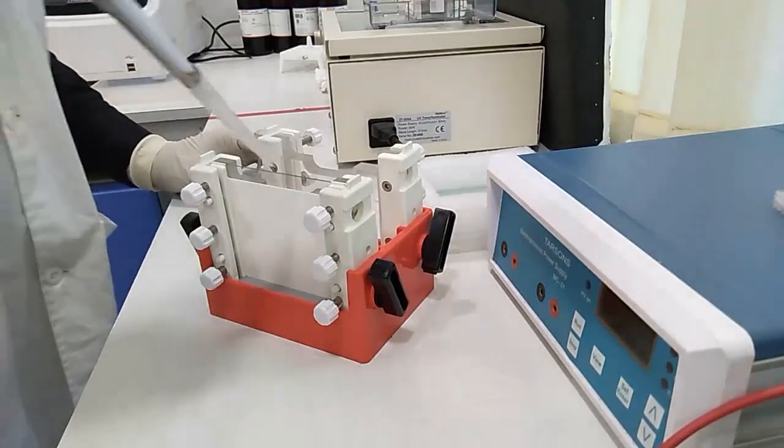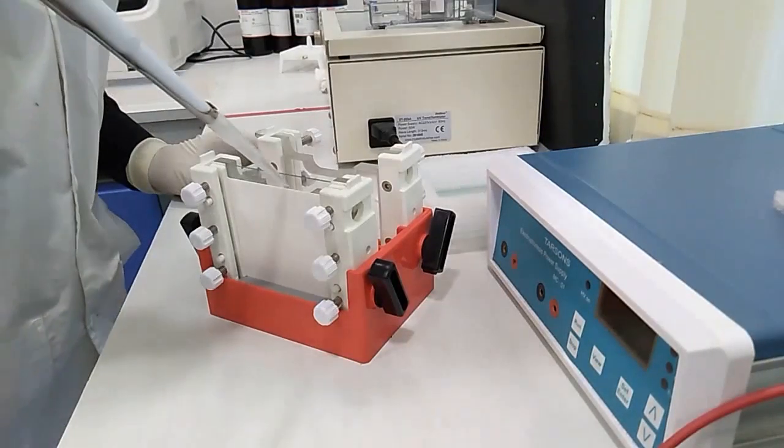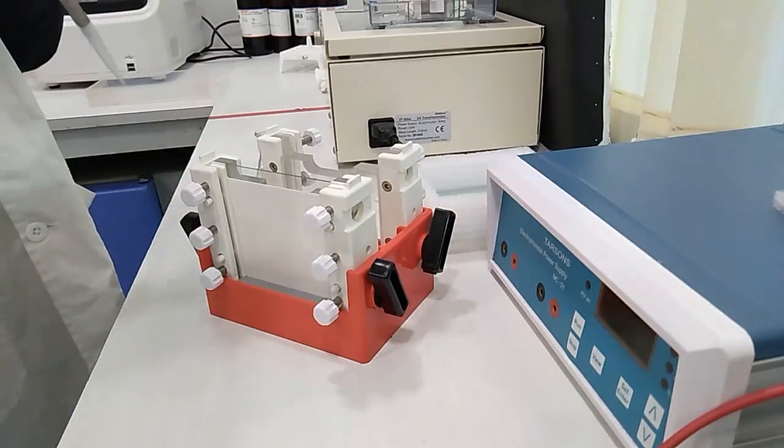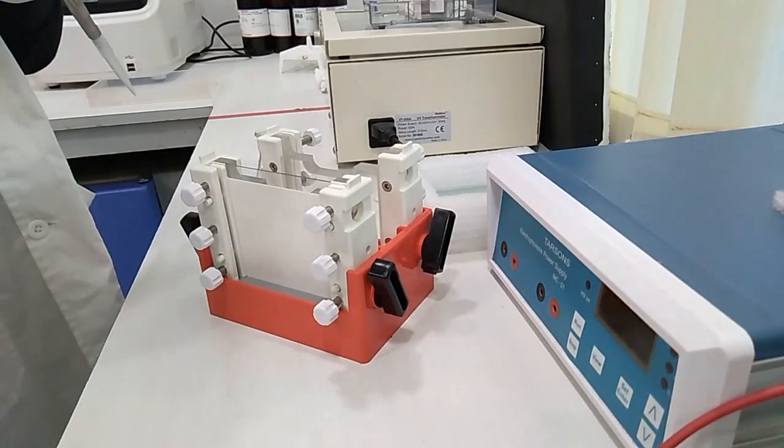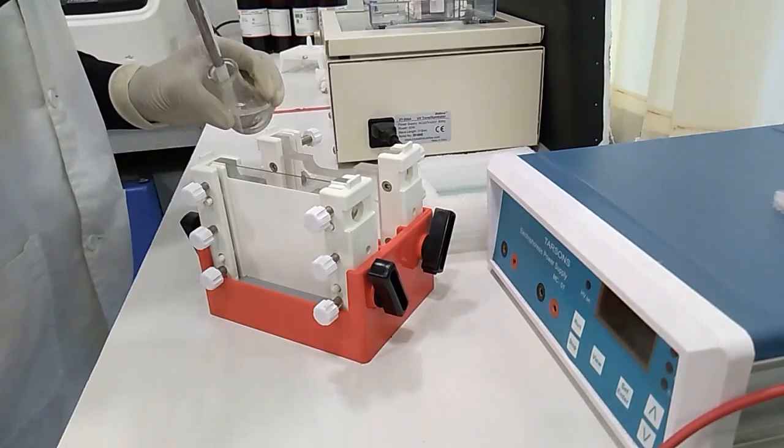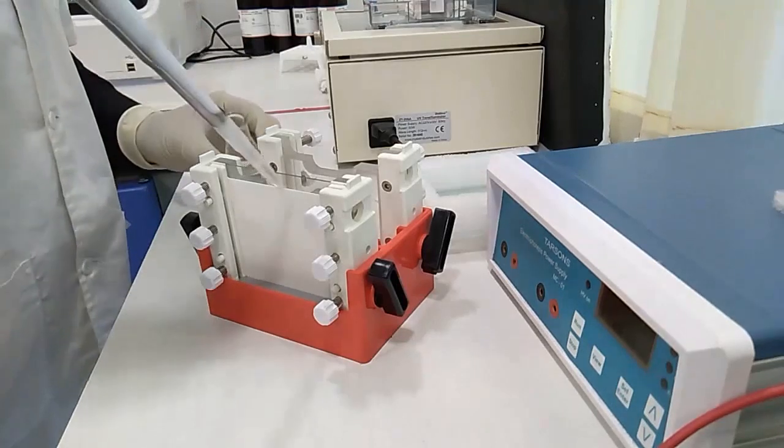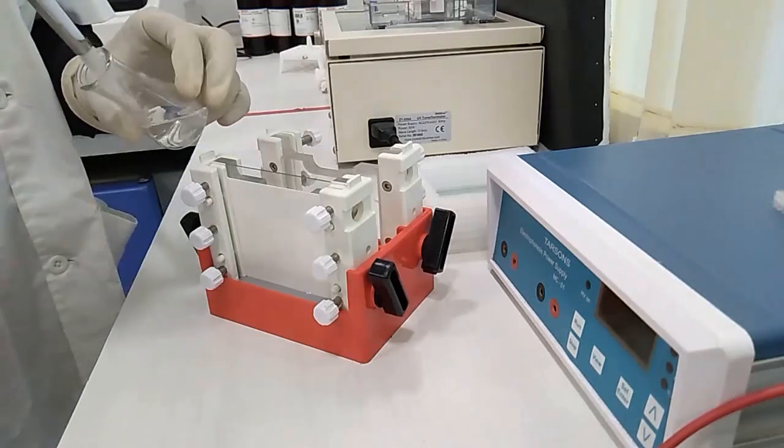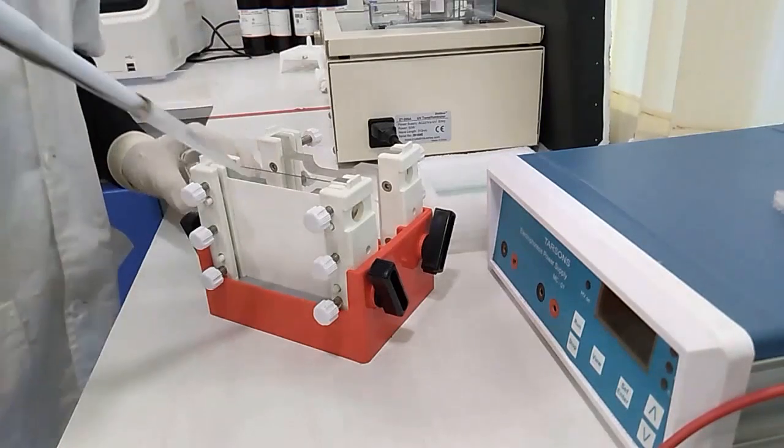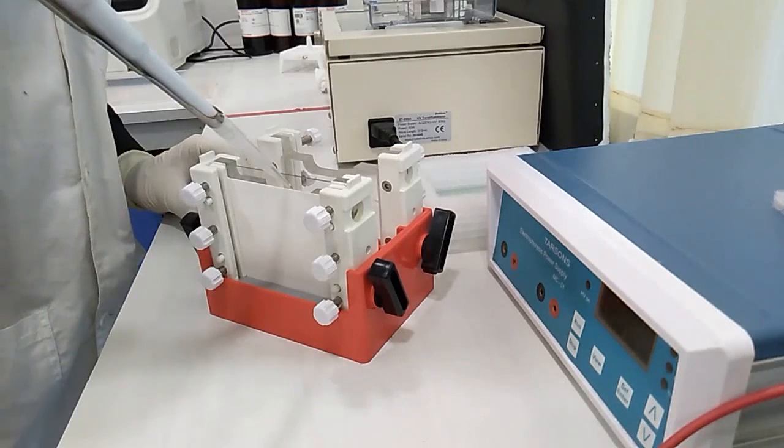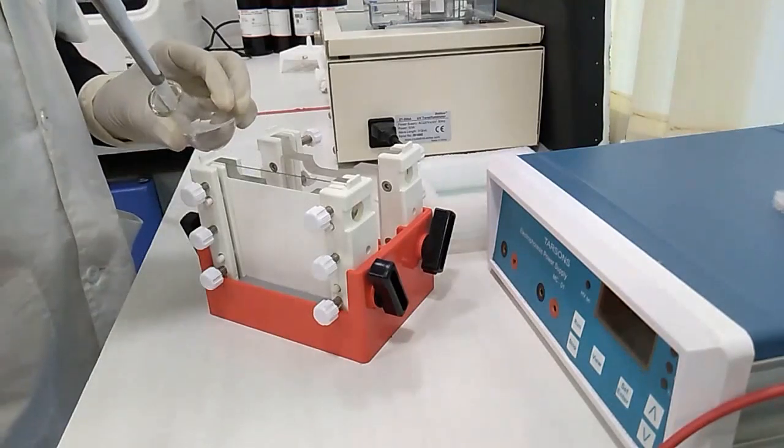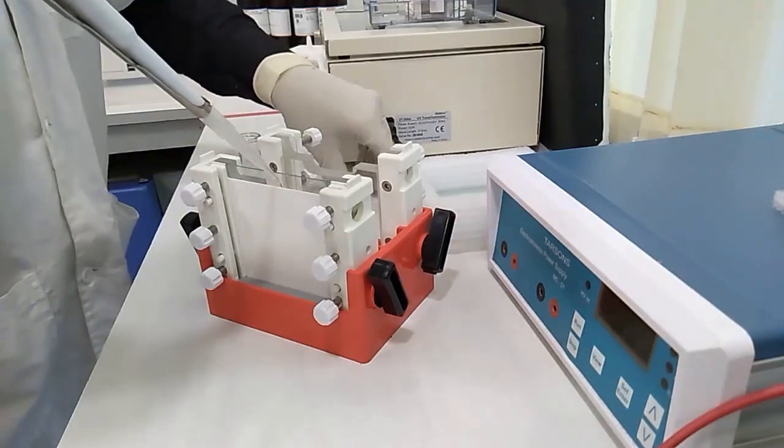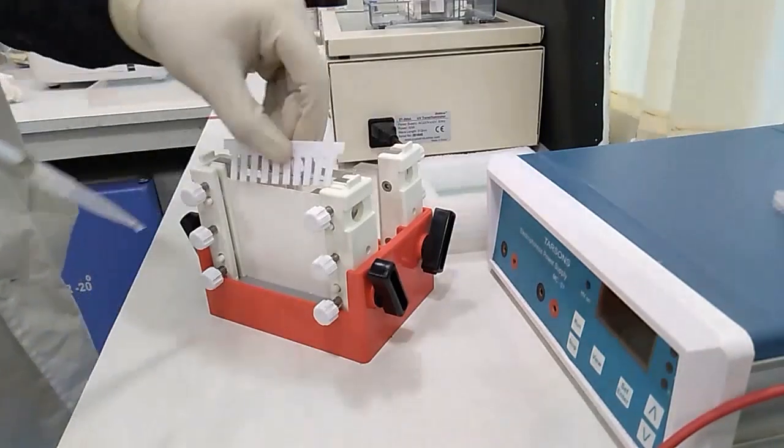Okay, now we will load the gel into the gel caster. We need to hurry rather the gel will polymerize and will stop there. We will place the comb.